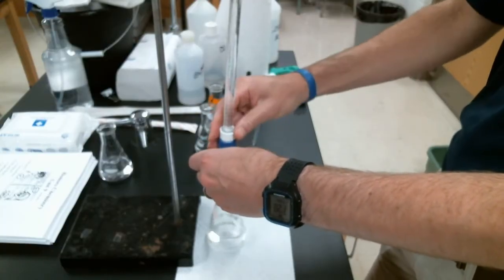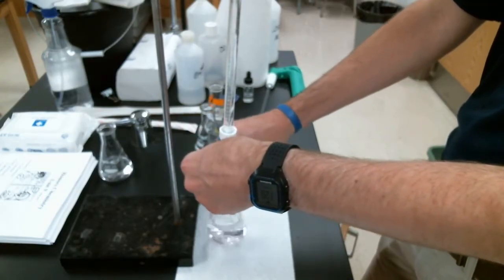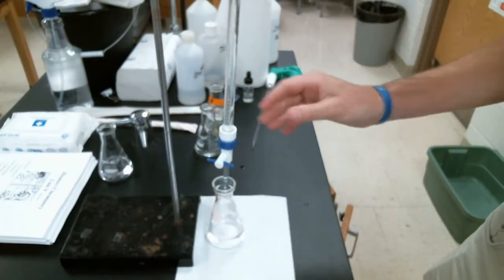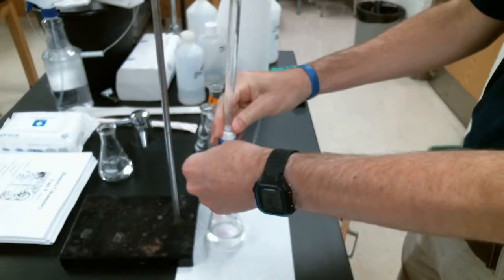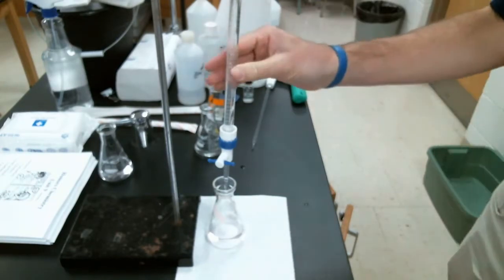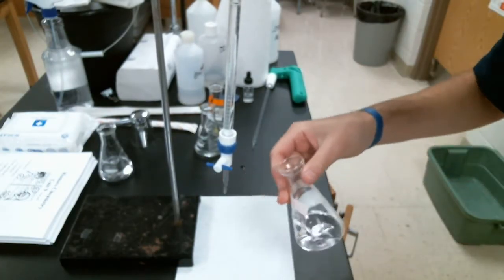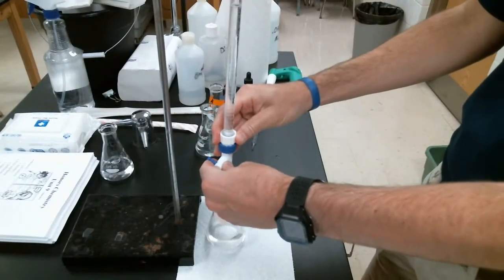Again, just barely open it up, a drop or two. A couple drops and swirl. Kind of let it sit. Again, let's see. Oh, I added a bit too much there. Okay, we're going to take a quick look again. Let's see, what do we think? Light pink. Not quite. Maybe super, super close. Just barely open it, a couple drops.